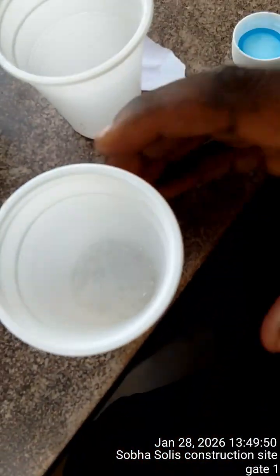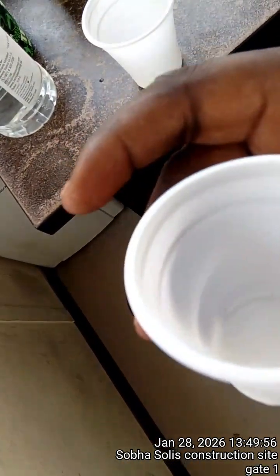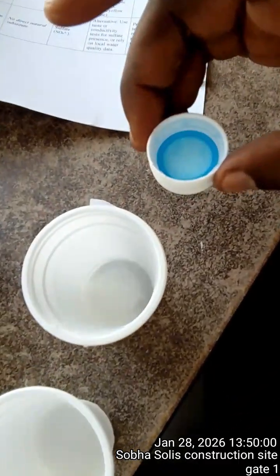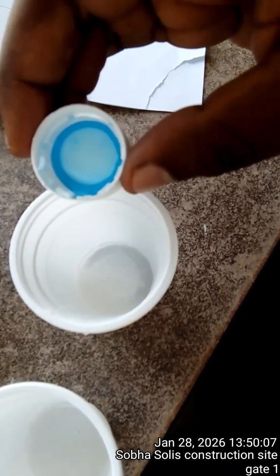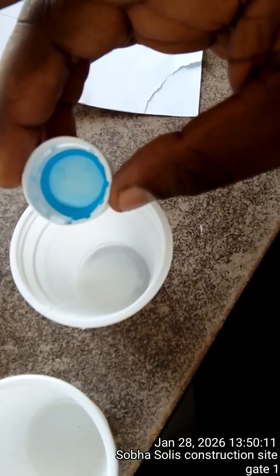So we are talking about the fizzing. In my first one, wow, I love the sound. I know you cannot hear it because you're very far, but let's observe together. This one I'm adding while you're also watching. So you see these bubbles? In this cup, it was like this. In this cup, there is only sodium bicarbonate inside. So this I'm going to add. Could you please watch and observe what I'm doing?